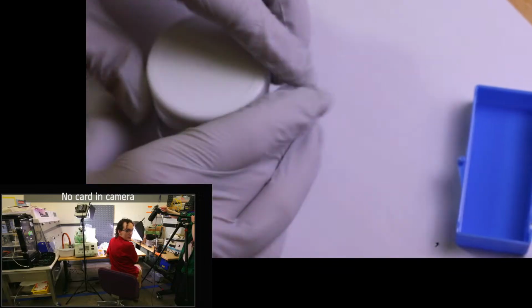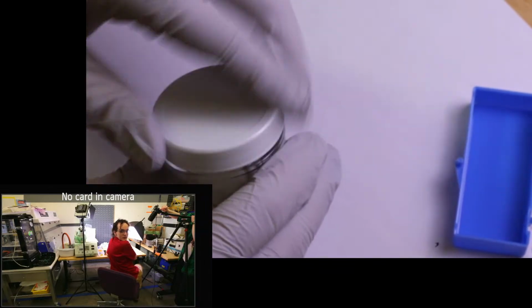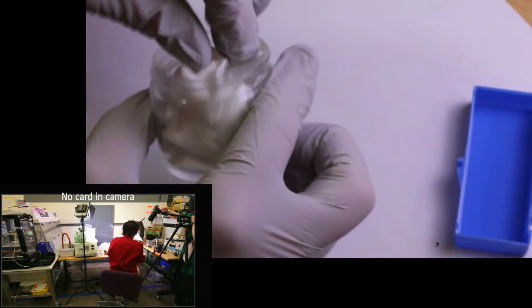So we're gonna go ahead and open up our jar here. So this is the samples we took from Merlin.